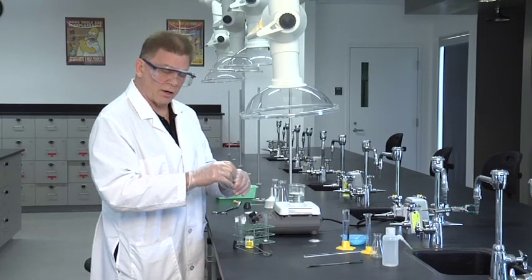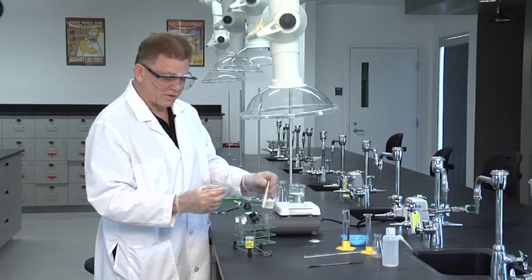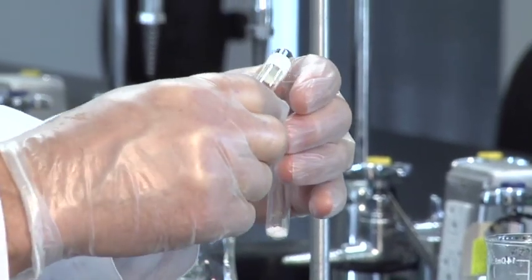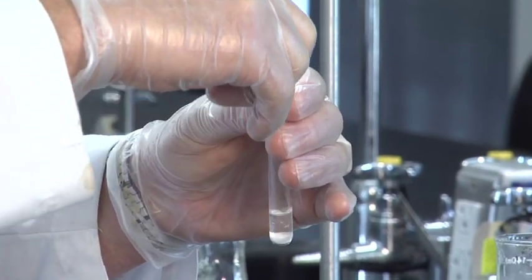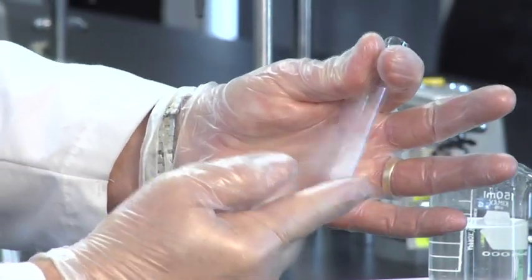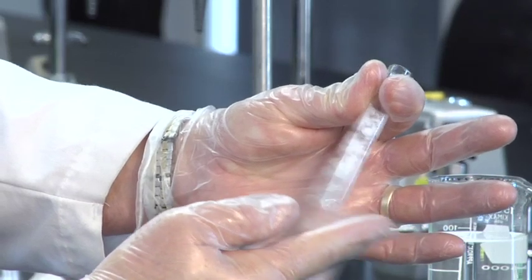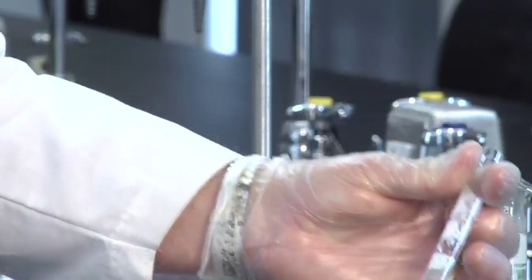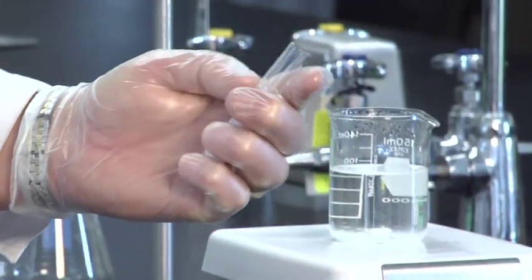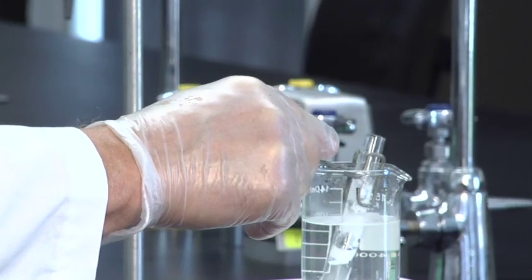The last solvent I picked was water. Usually water is not a very good solvent for most organic materials. Let's see how it works with benzoic acid. I'll put two milliliters of DI water onto some benzoic acid. That's not working at all — but that's good, so far water is still in the race. Let's put water into the hot water bath and heat it up to see what happens.